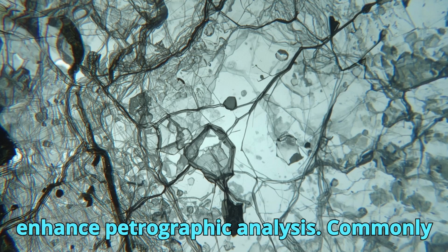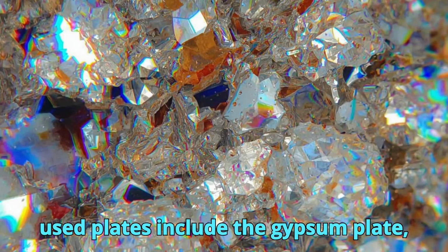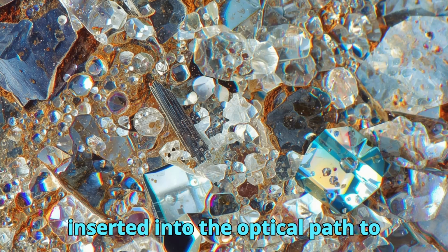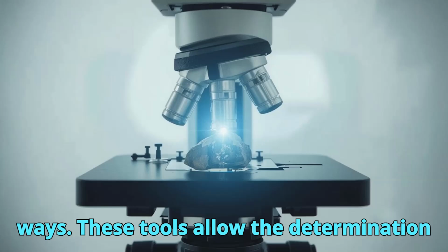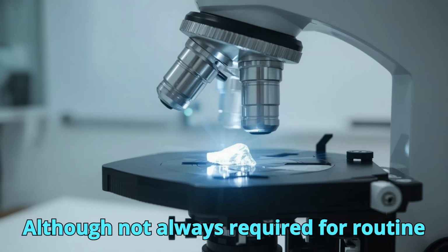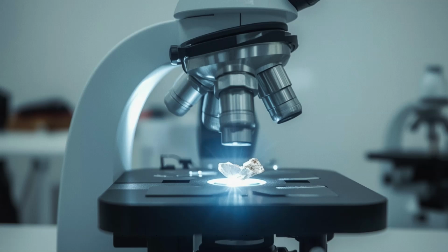Accessory plates further enhance petrographic analysis. Commonly used plates include the gypsum plate, quartz wedge, and mica plate, each inserted into the optical path to modify interference colors in predictable ways. These tools allow the determination of optical sign, birefringence order, and crystallographic orientation. Although not always required for routine identification, accessory plates are invaluable for advanced mineralogical analysis.